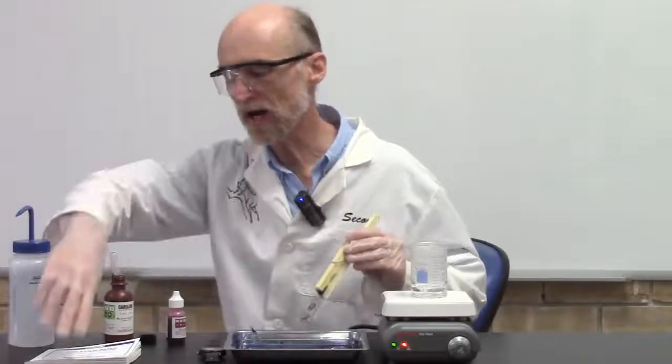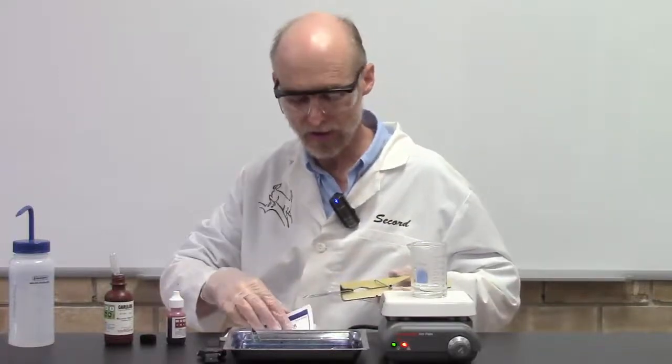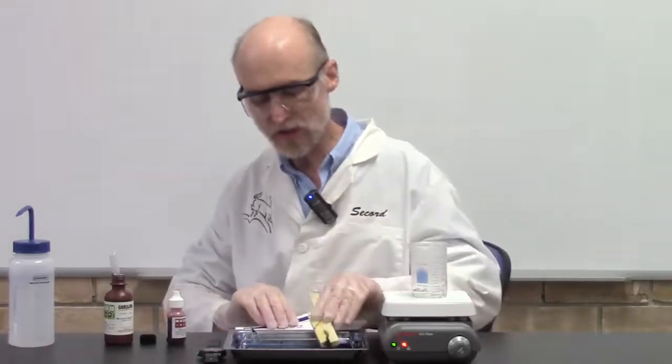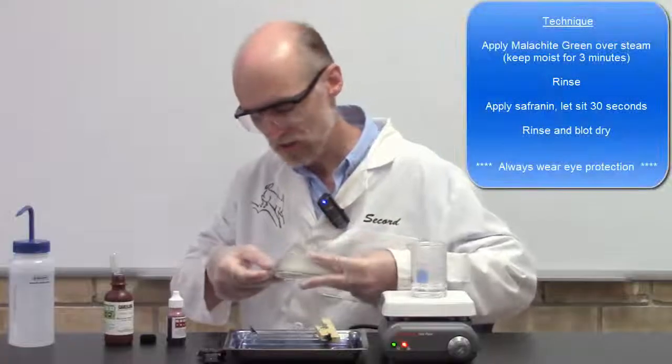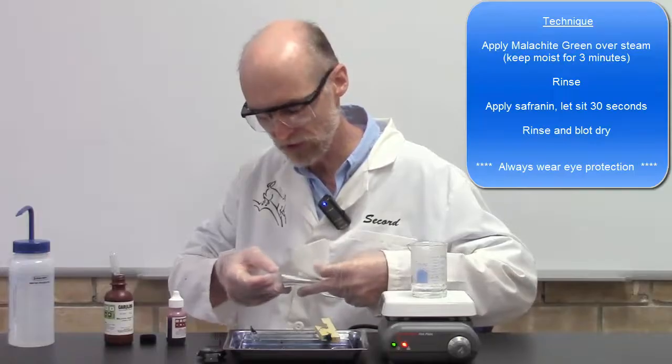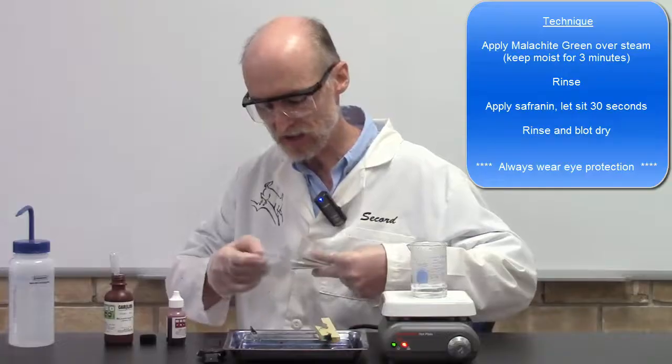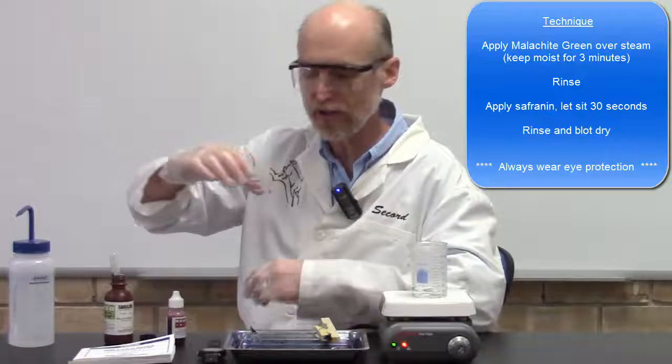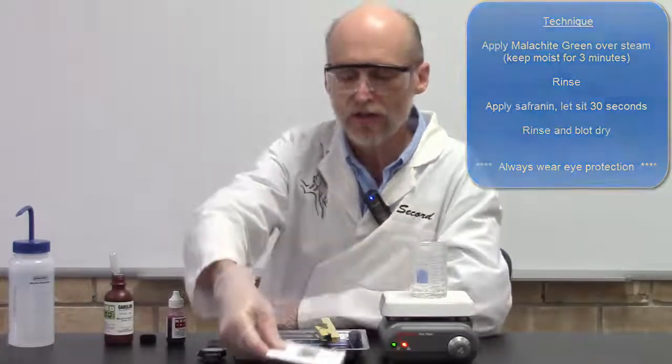Now we're ready to blot dry. And remember, you don't want to rub the bacterial smear because you don't want to rub off the bacteria. So the best thing to do is just to gently pat it dry. And you might have to move it around a few times so you can absorb all the moisture. And once you have all the moisture taken off the slide, you're ready to observe it.